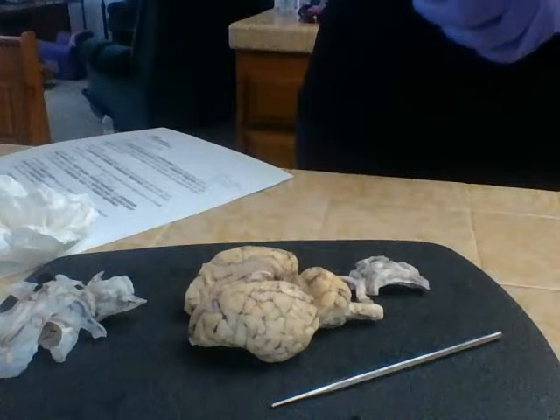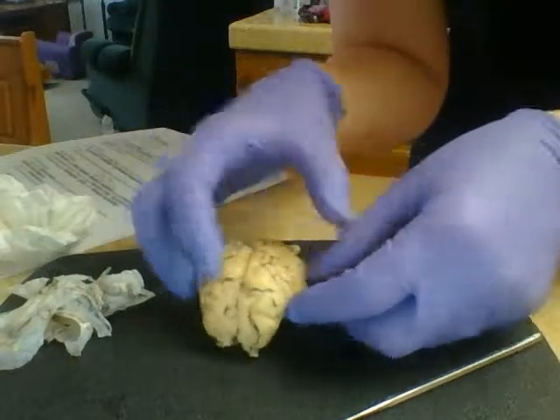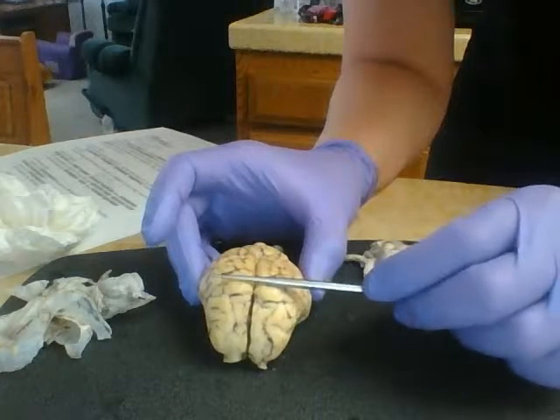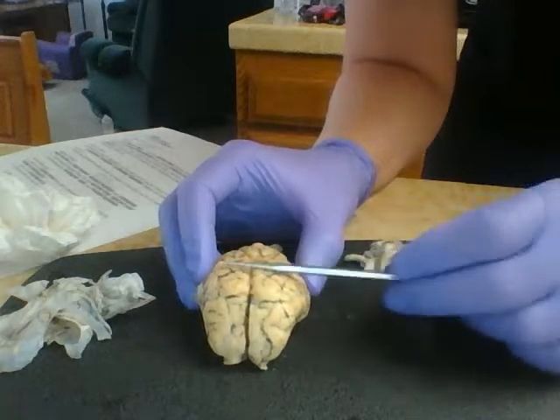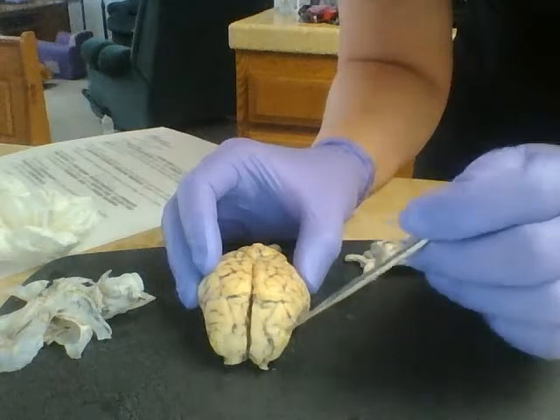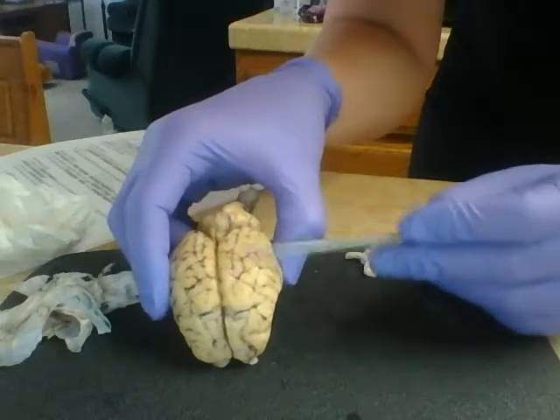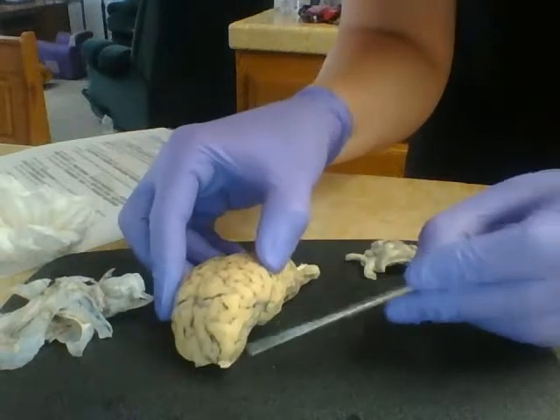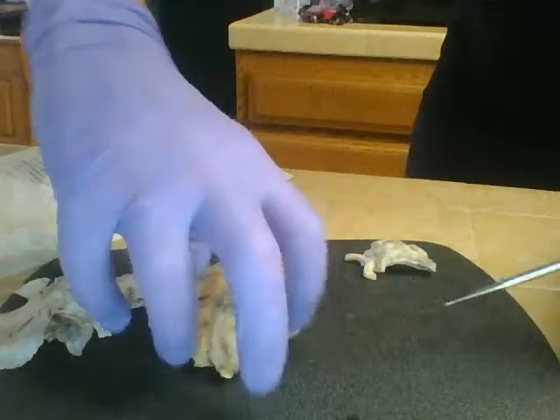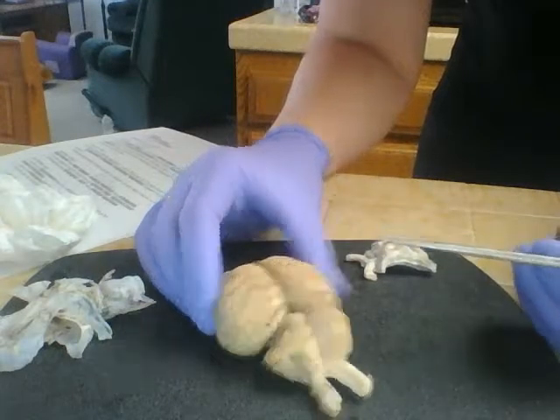Okay. As you can see, we've got our guy here laid out, my pile of meninges that I had peeled off earlier. So looking at the posterior aspect of the brain, the dorsal portion of the brain, here at the front we've got our frontal lobes. Then back here, kind of on the dorsal portion of the brain, we have the parietal lobes. On the side here we have the temporal lobes that kind of extend back in between. And then on the back of the brain, the posterior portion of the brain, we have occipital lobes, and those are both on the right and left hemispheres of the brain.